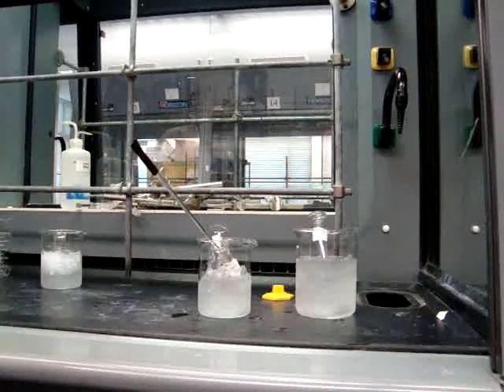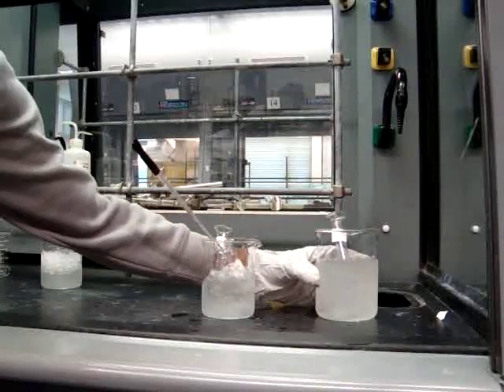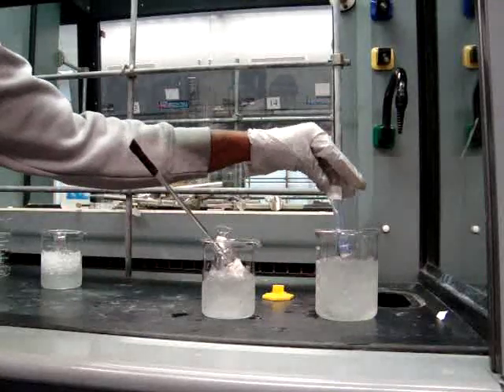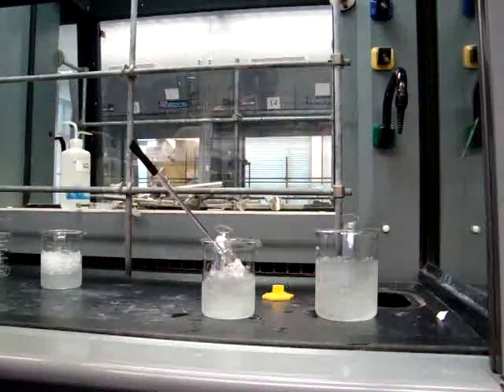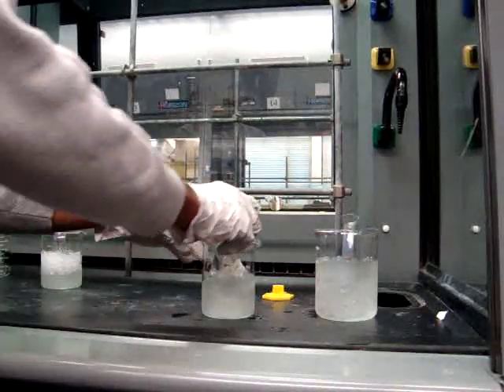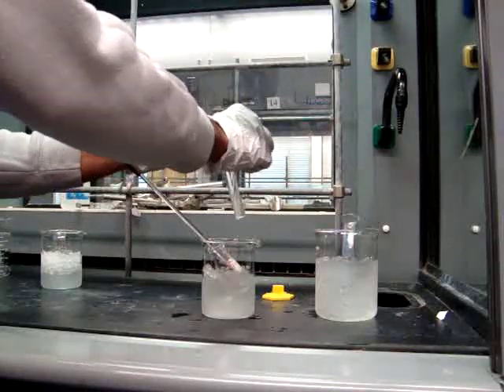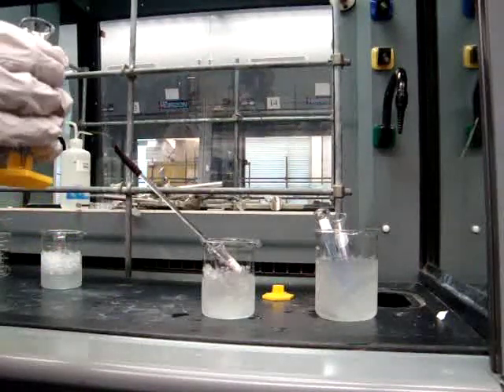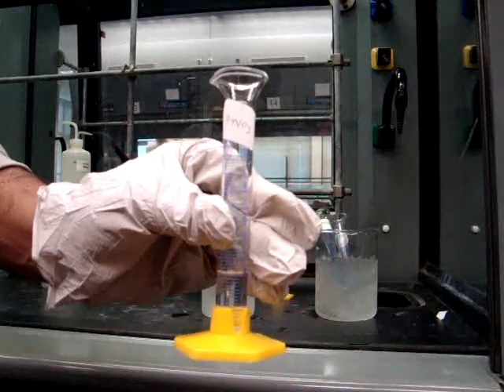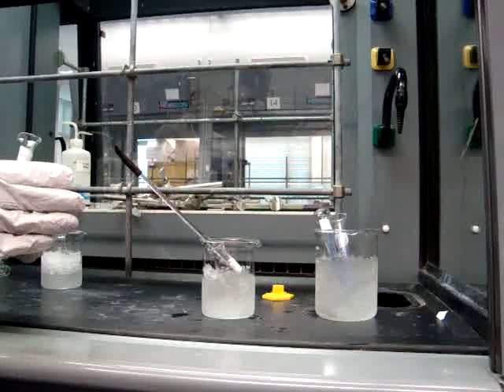In order to keep the temperature below 0 degrees Celsius, you'll be adding 5 grams of salt to each beaker of ice. It is important to keep everything very cold during the reaction so that the products turn out the way you'd like them. First, it is important to keep the nitric acid and sulfuric acid mixture cold, because when you add the sulfuric acid slowly to the nitric acid, you need to make sure that the nitronium ion is stable. If it is heated to above 0 degrees Celsius, you will lose the nitronium ion and the reaction will not go completely.